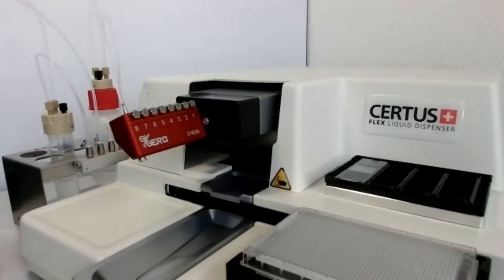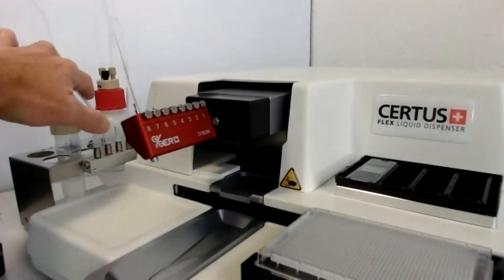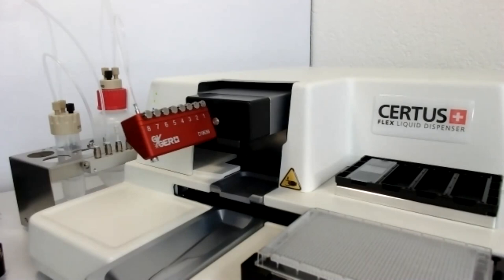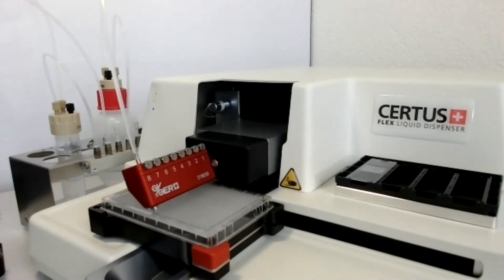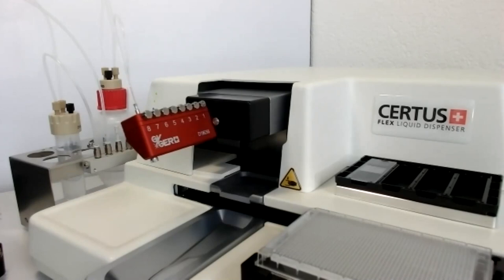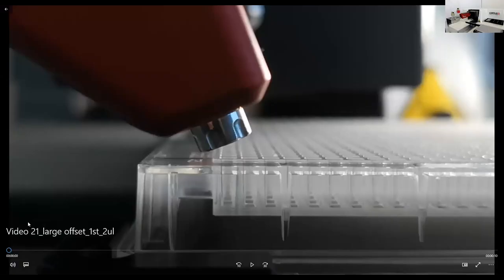I'm going to switch to the other cam. So we are connected to a 250ml conical bottle connected to channel 8. There is only one micro valve located in the dispensing head. I'll quickly switch to my software. Now, I'm going to dispense just one line at the front with channel 8. As you can see, the head is 22 degrees angle, which allowed us to dispense on the well wall to be more gentle, especially for cell dispensing. It's hard to see it on the webcam. Therefore, I pre-recorded a slow motion movie, which I'd like to present you now.